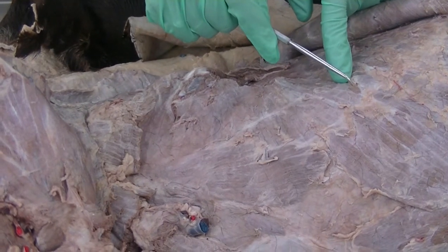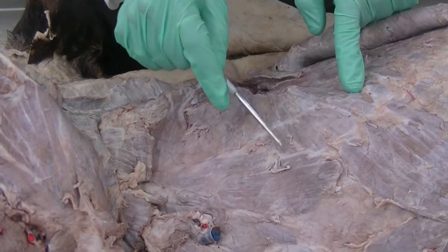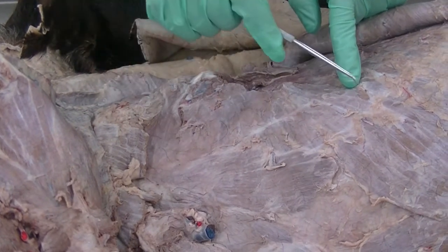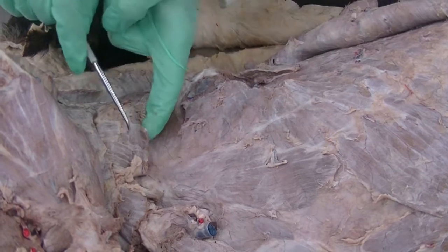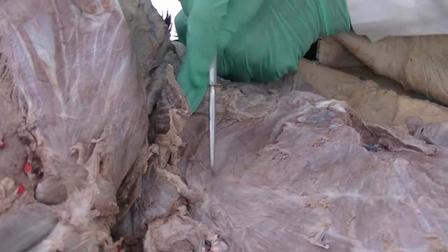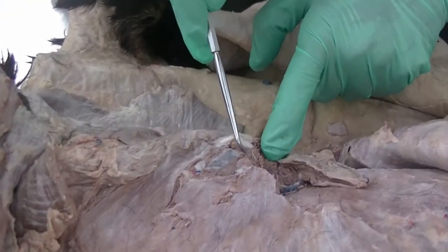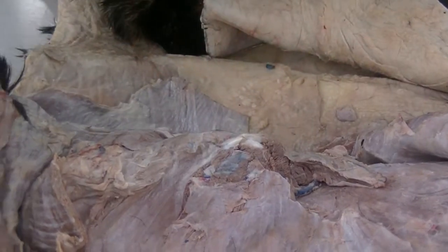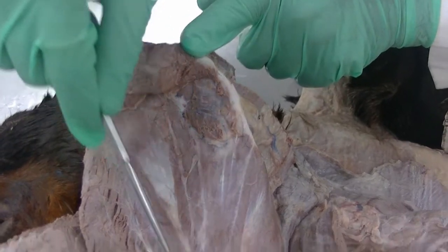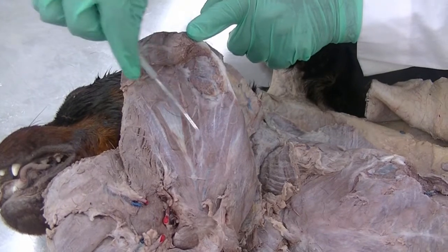From around rib number 8 all the way to the cervical vertebrae, that muscle with serrated margin is a fan-shaped muscle which is extended from the thoracic region to the cervical region. As we reflect some of these muscles, we can see the remaining part of the serratus ventralis associated with the neck, and we can see the area where it is attached to the scapula on its medial side. This is the attachment area for the serratus ventralis on the scapula, while rest of the subscapular fossa is occupied by the subscapularis muscle.